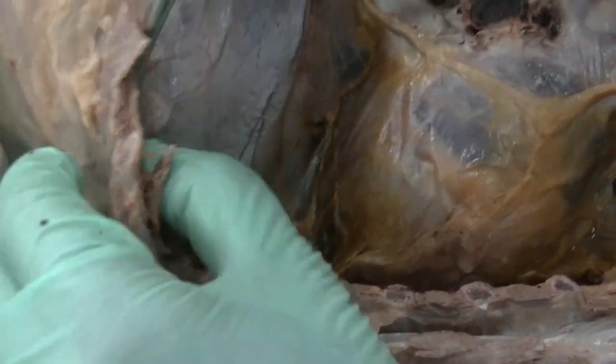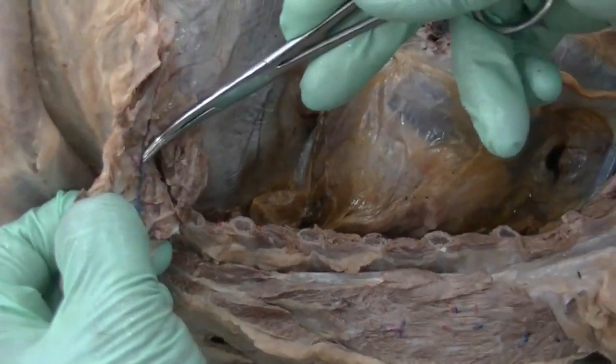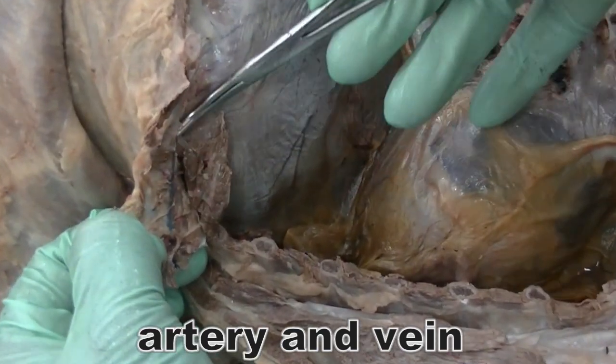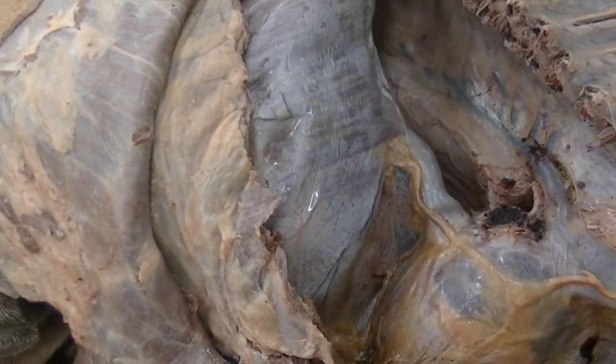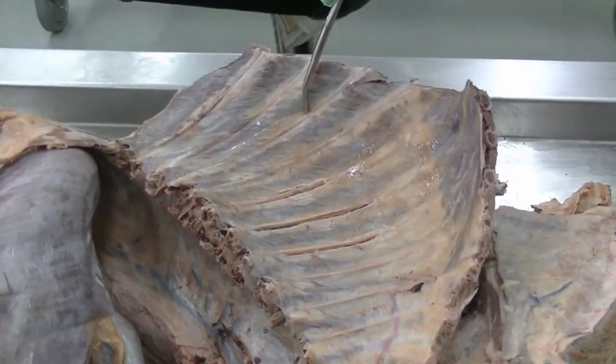Now, as we follow the inner surface of the wall of the thoracic cavity here, this is the musculophrenic artery, which accompanies the costal arch and gives off the costal or ventral intercostal branches in this region to anastomose with the dorsal intercostal arteries as well as the veins. Okay?